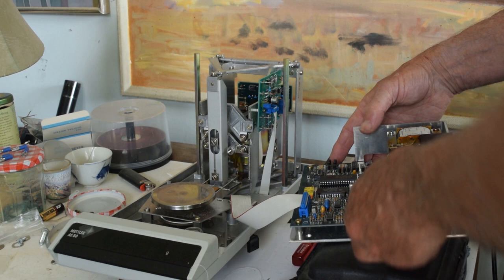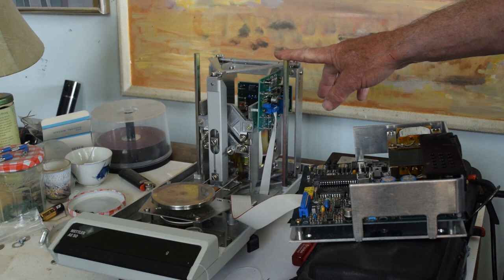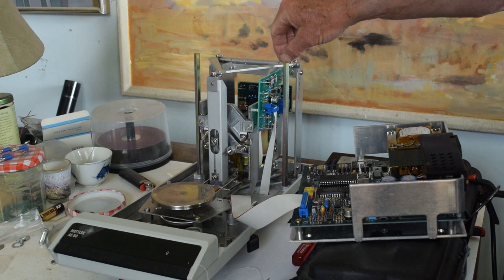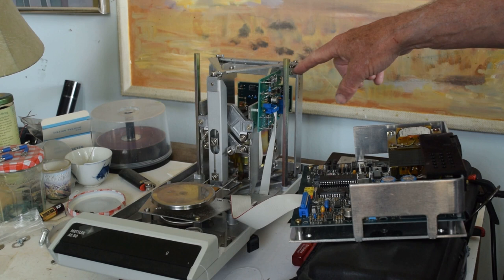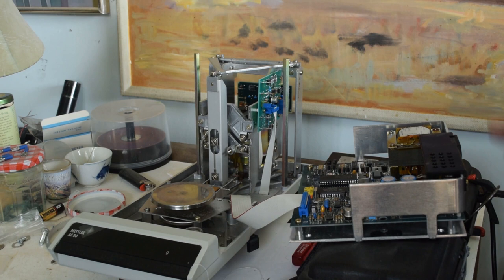When I got the balance it didn't work at all, and I assumed it had been badly damaged. So I took it apart to this point, found the broken flexure, took the top frame apart, put the new flexure on, and it started to weigh. It did not, however, calibrate or weigh anything over 30 grams.